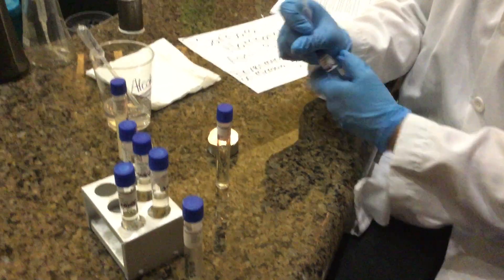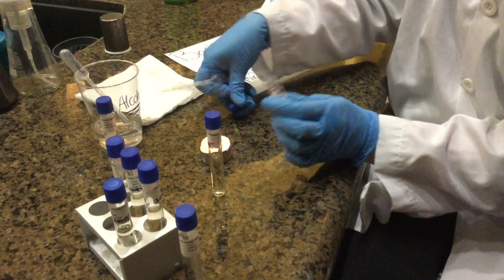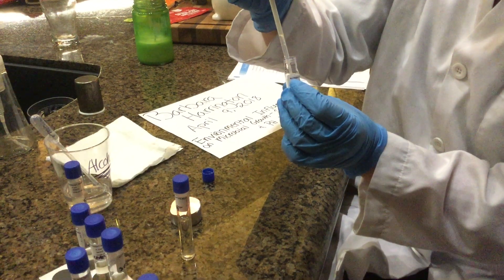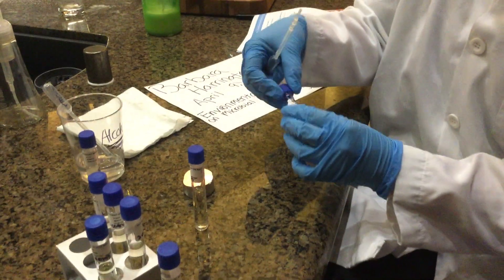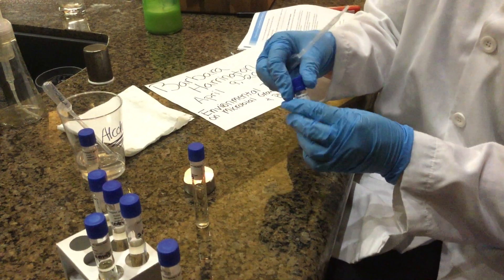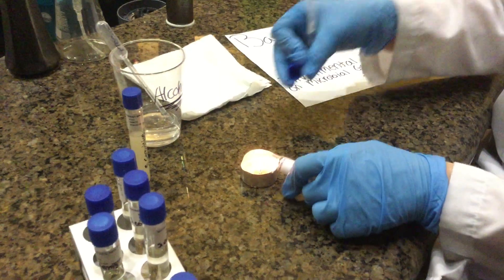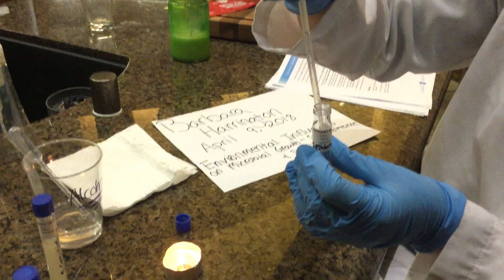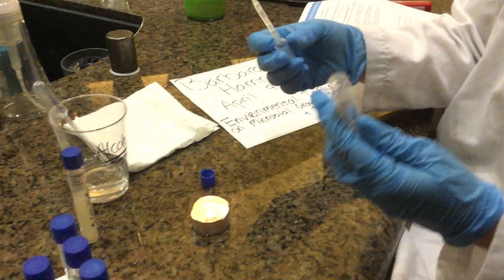And then once I'm done inoculating these, I'm going to incubate them at my site, my little incubation site, for 48 hours to see if I see any turbidity or growth. And then we'll do some following tests after that. We've got one more to inoculate. Two drops. Those have some bubbles in it. There we go.